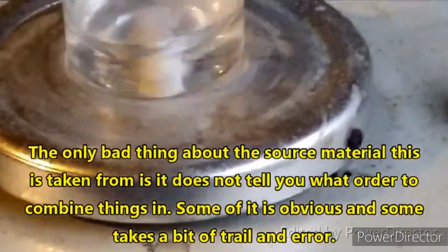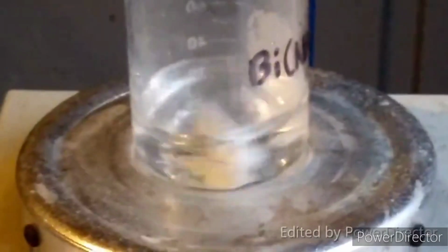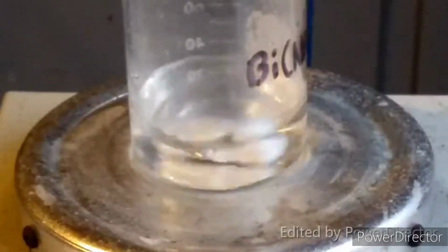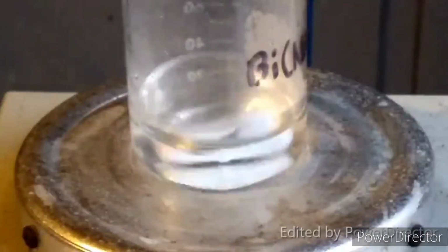Let's see here. You guys can see things a little better than that. Yes, the tripod is just as cheap as the camera, guys. It's not called the poor man's chemist for nothing.